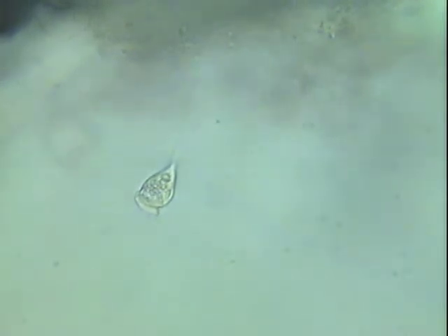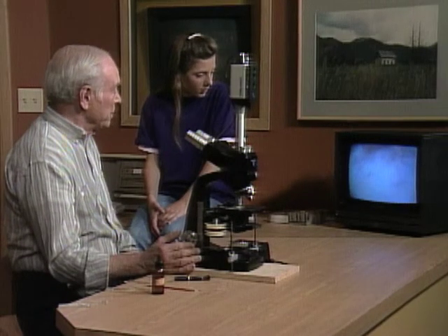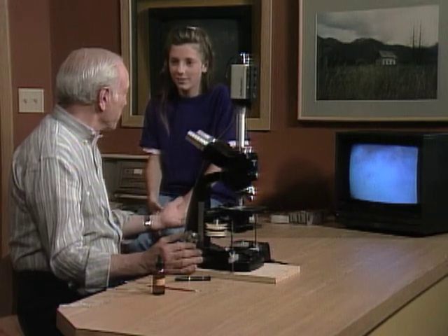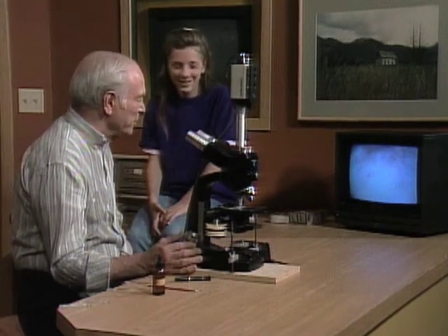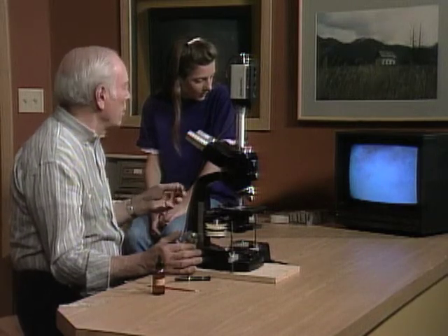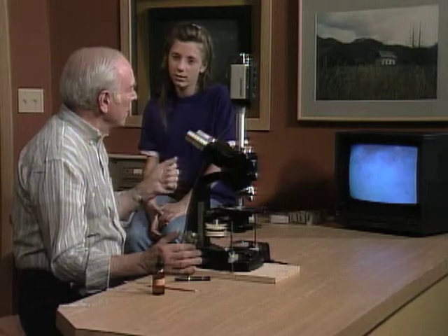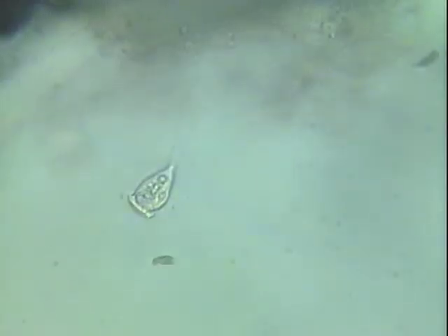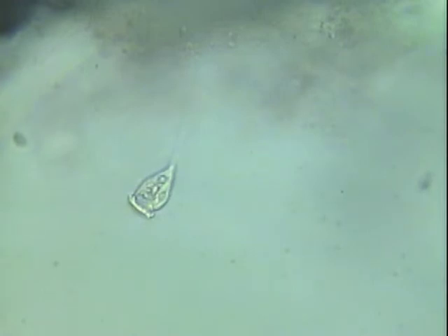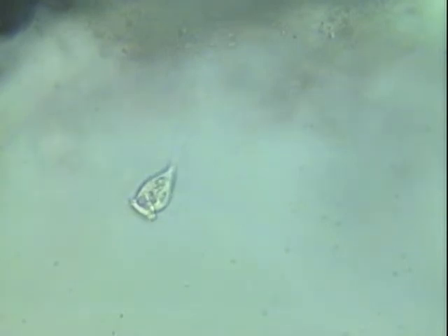One reason it's very often studied by beginning biology students is because it's anchored to something, so it doesn't go swimming away — it's easy to see. Inside you can see all the things that are in a cell: the nucleus and all that. As food is drawn into it, it extracts what it can and then sends waste out through the same opening. This famous pond animal is called a vorticella.